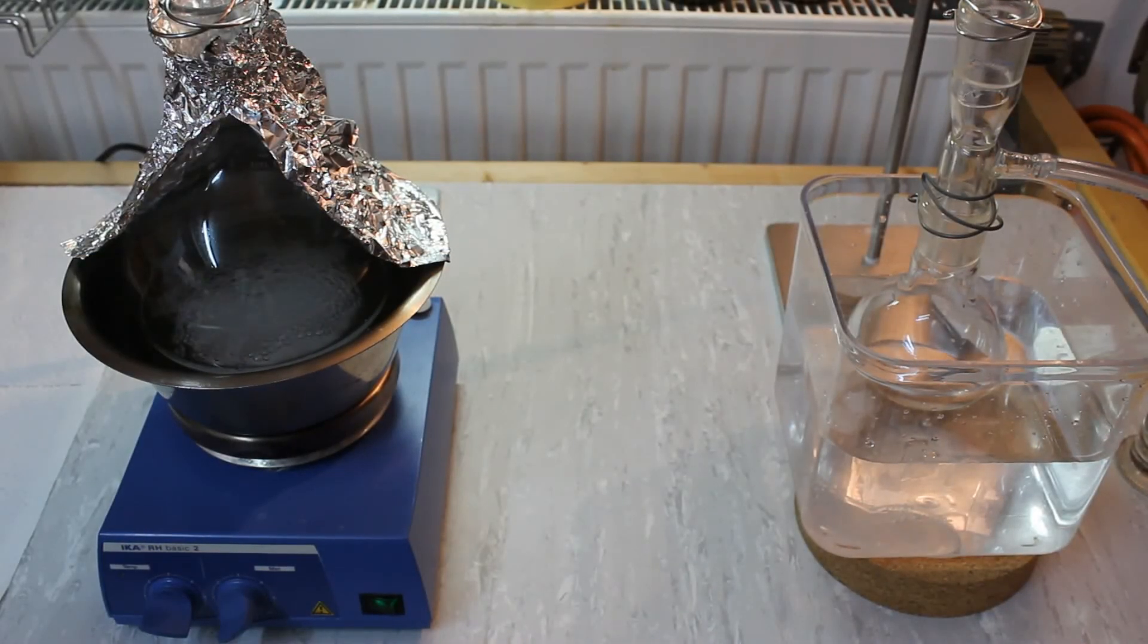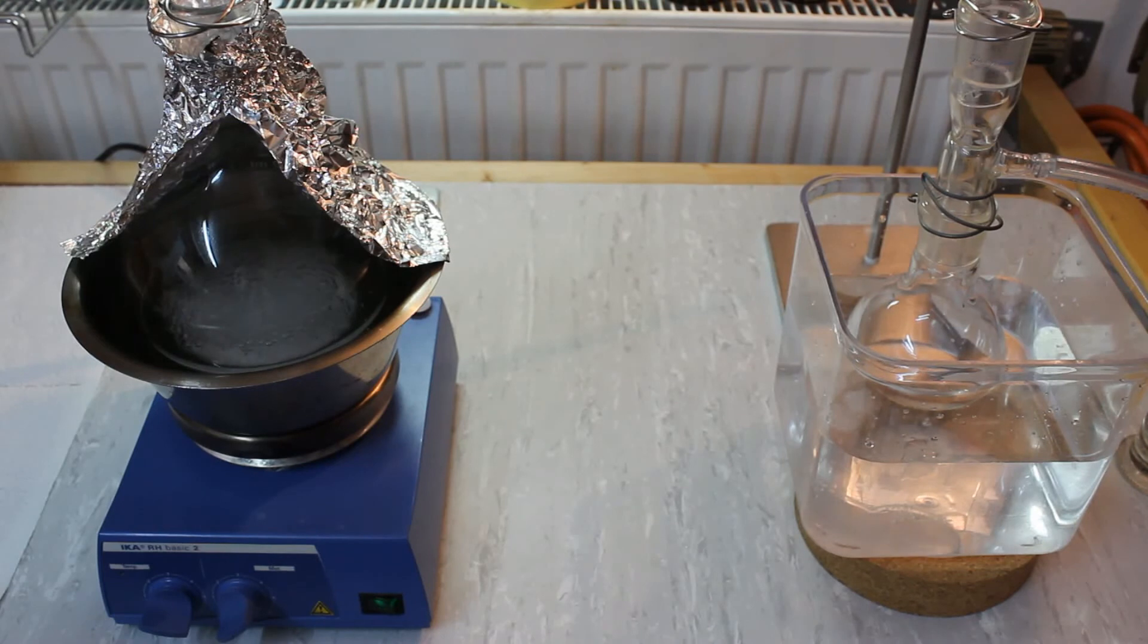The ether has reached a gentle boil and we are now collecting our reasonably pure product. The stillhead temperature is reading a constant 37 degrees Celsius indicating that we do have in fact some impurities in there. But for my purposes it's going to be alright.